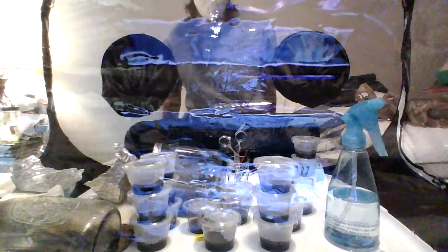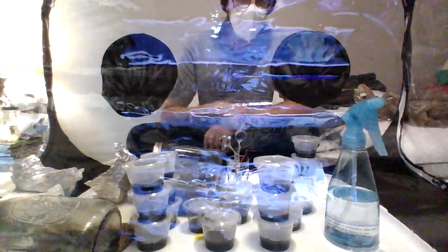All right, guys. So as you can see, we got some new stuff. A couple new tools in our still air box today. We have some all metal stainless steel scissors and some tweezers that I cleaned up. And now they're soaking in some 70% isopropyl alcohol in a shot glass. You can use whatever, just something to hold rubbing alcohol that you can stick your tools in, preferably something that's got some weight to it so it doesn't just tip over and then you're like, spillage. Where'd my gloves go? There they are.